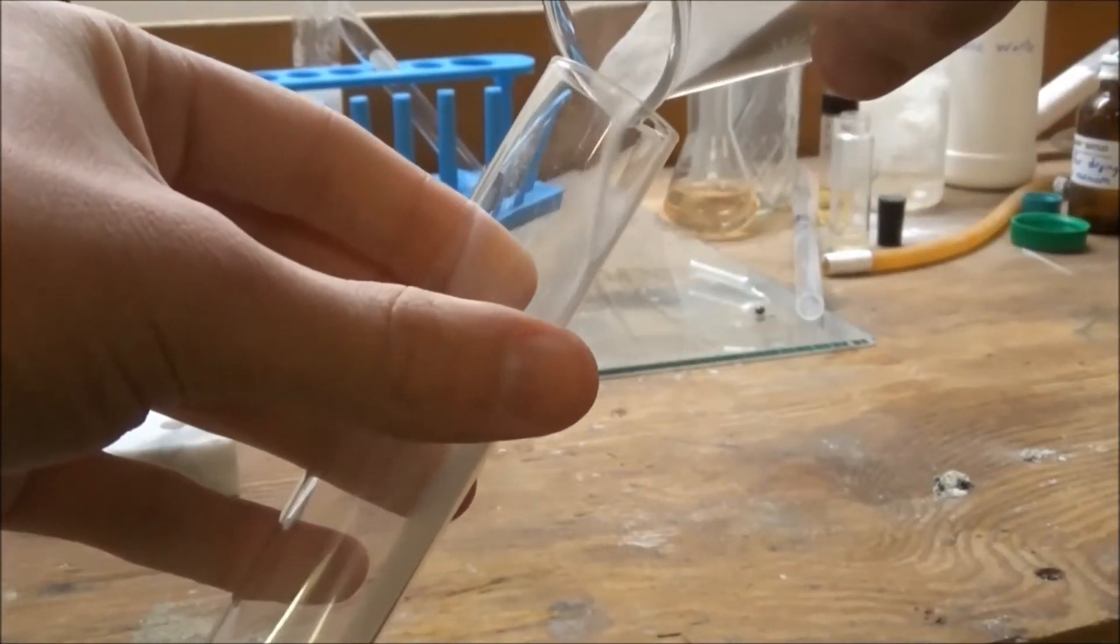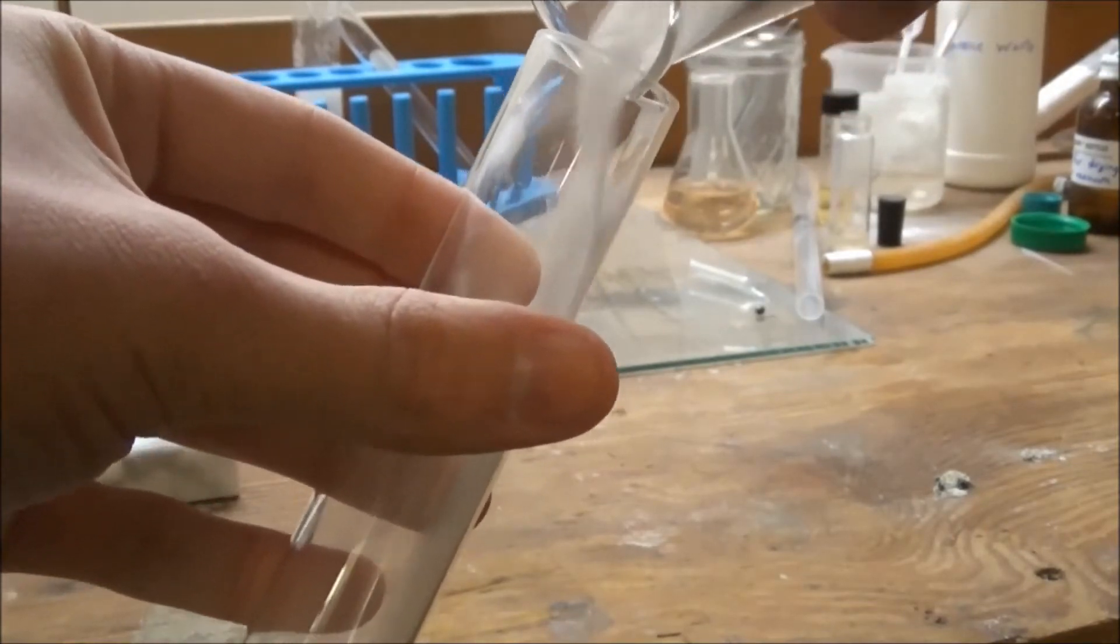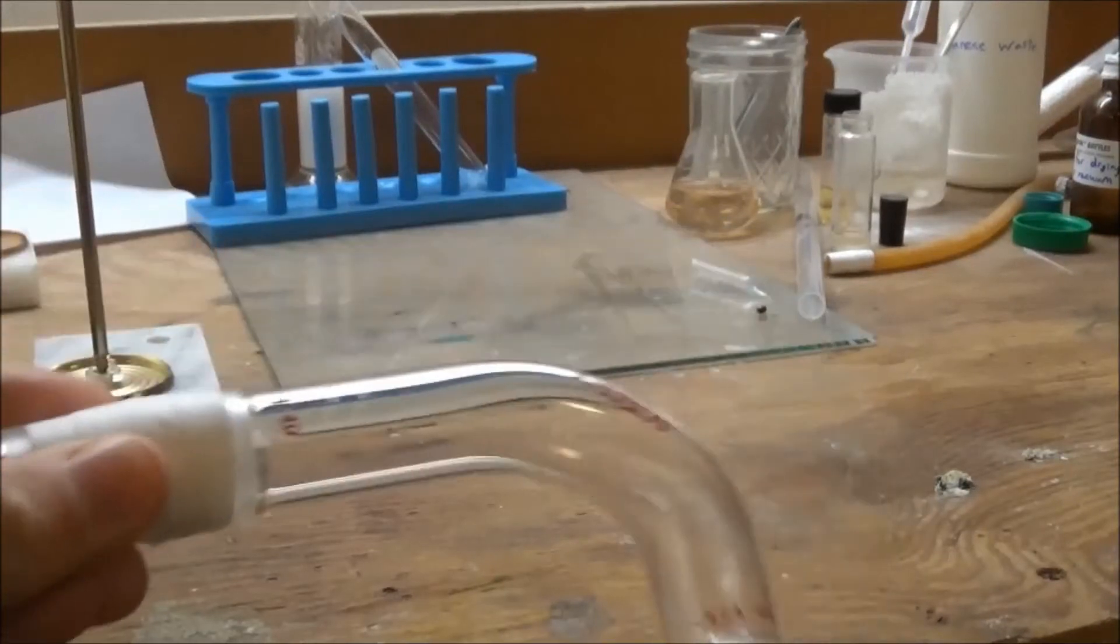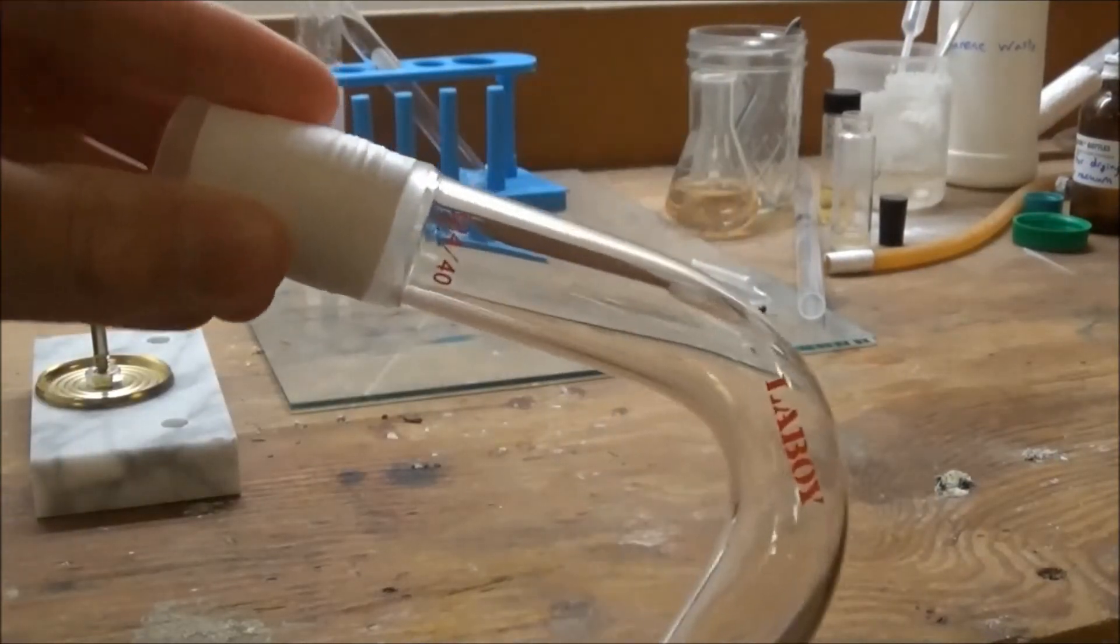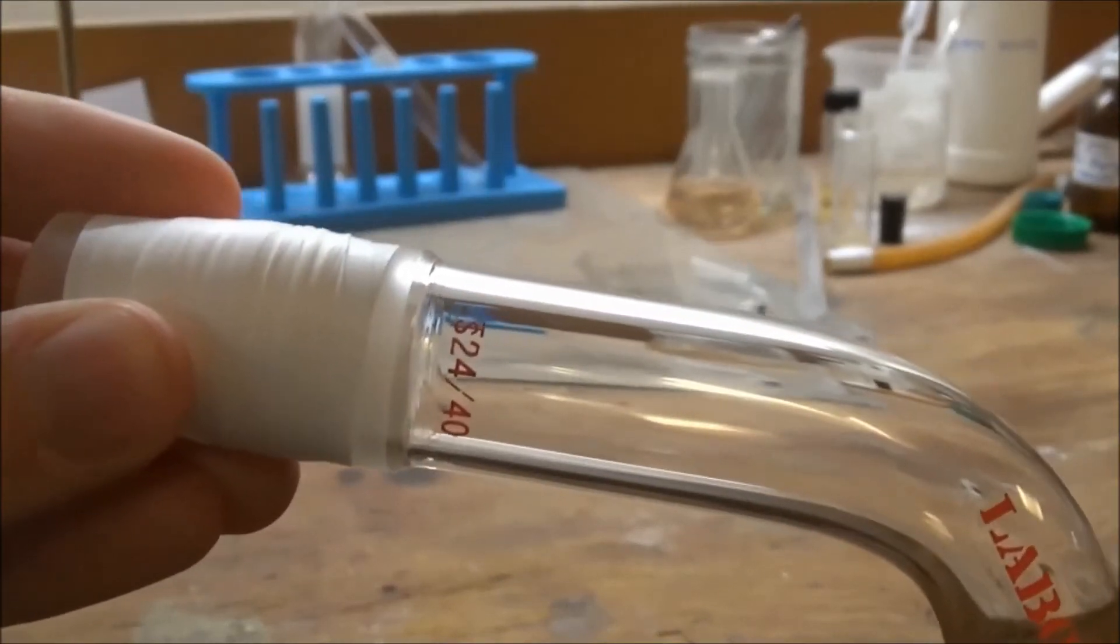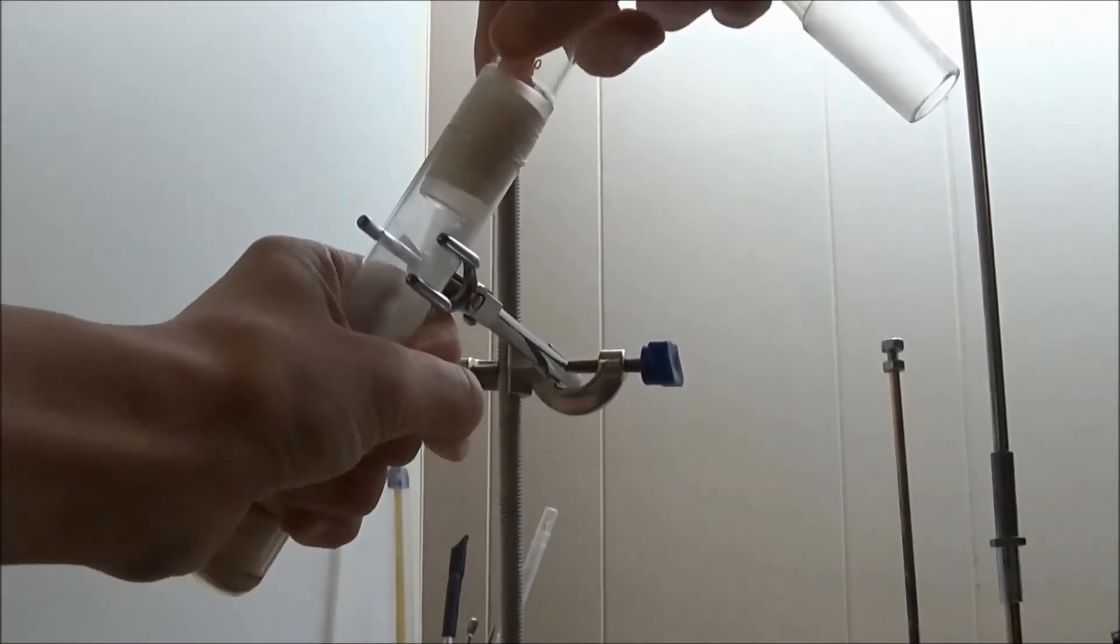Next I wrapped a distillation adapter with a generous amount of PTFE tape in order to make a good seal. I then fit this adapter into the test tube and attached the rest of my apparatus.